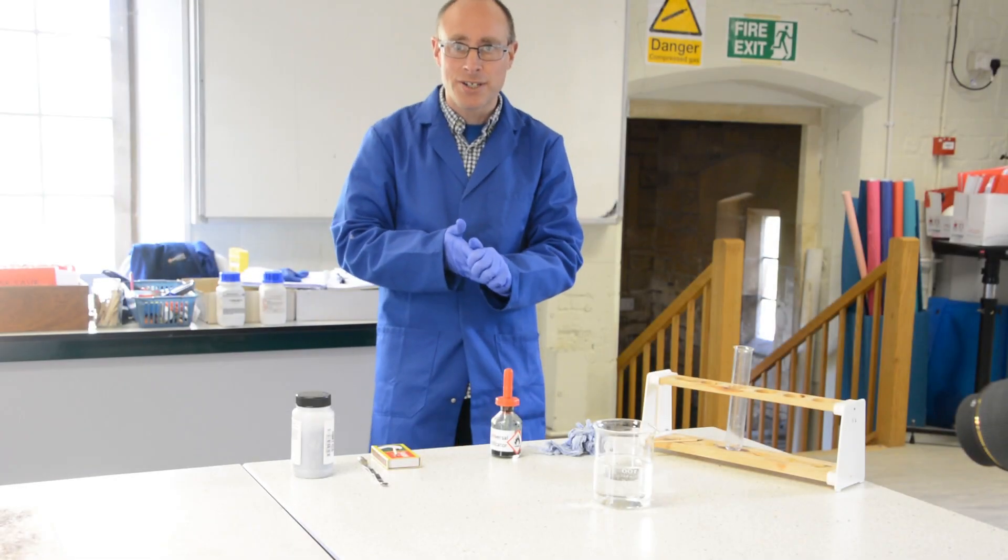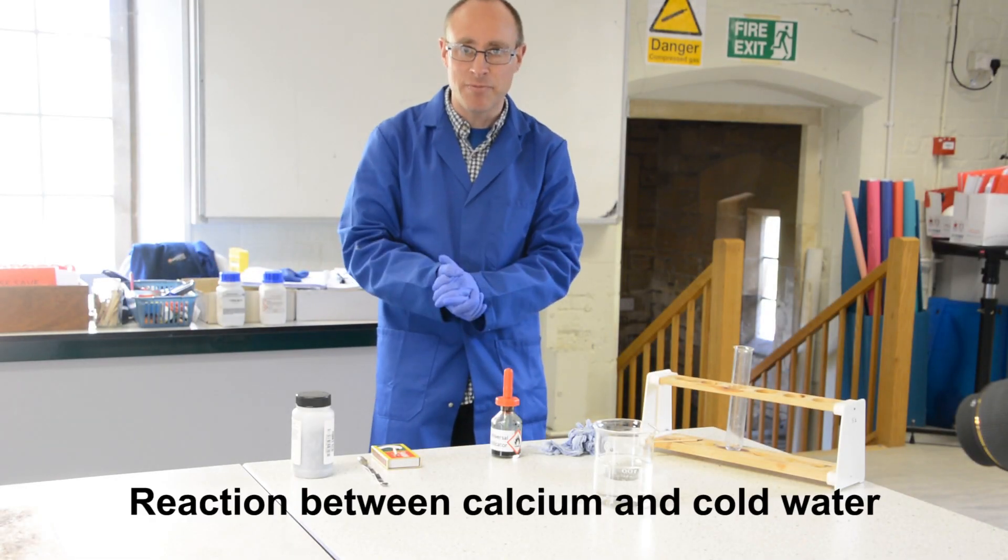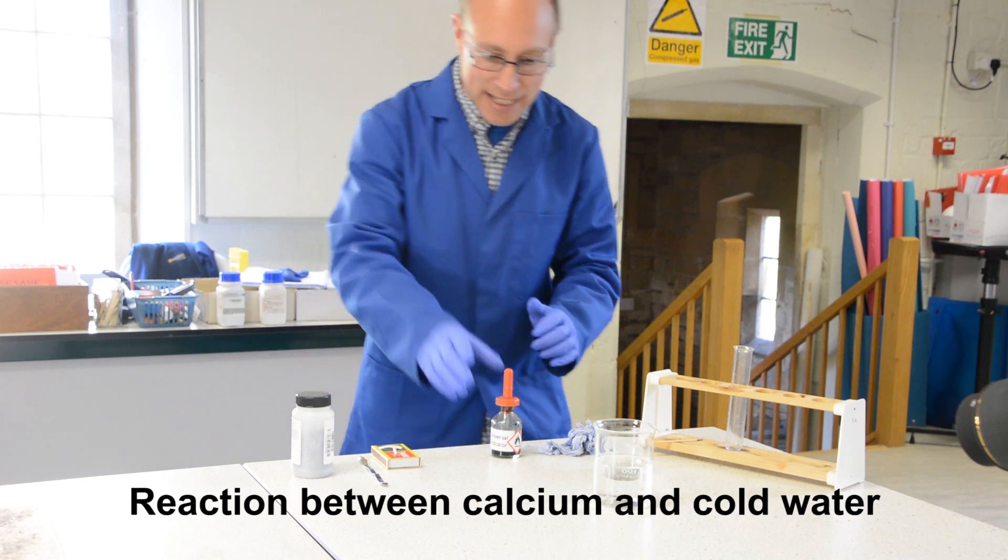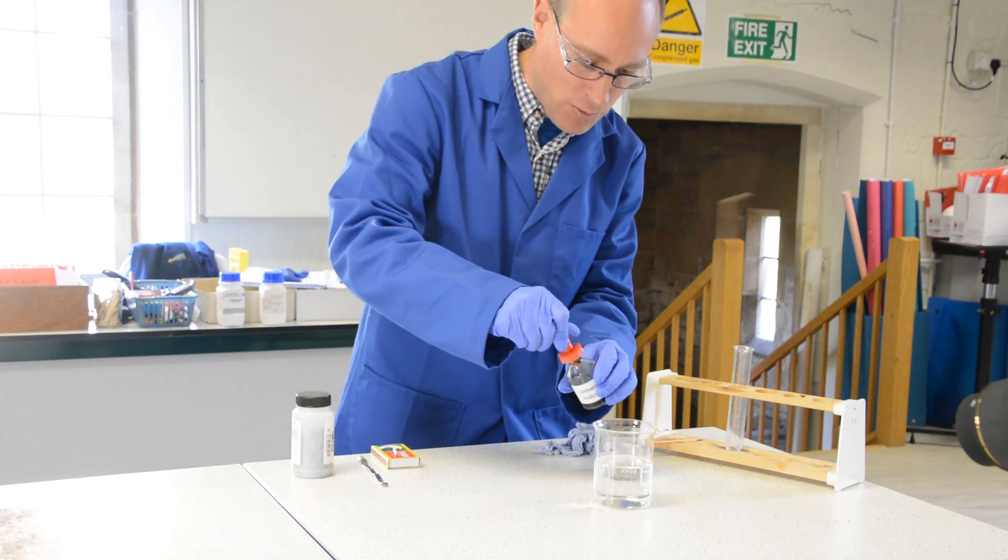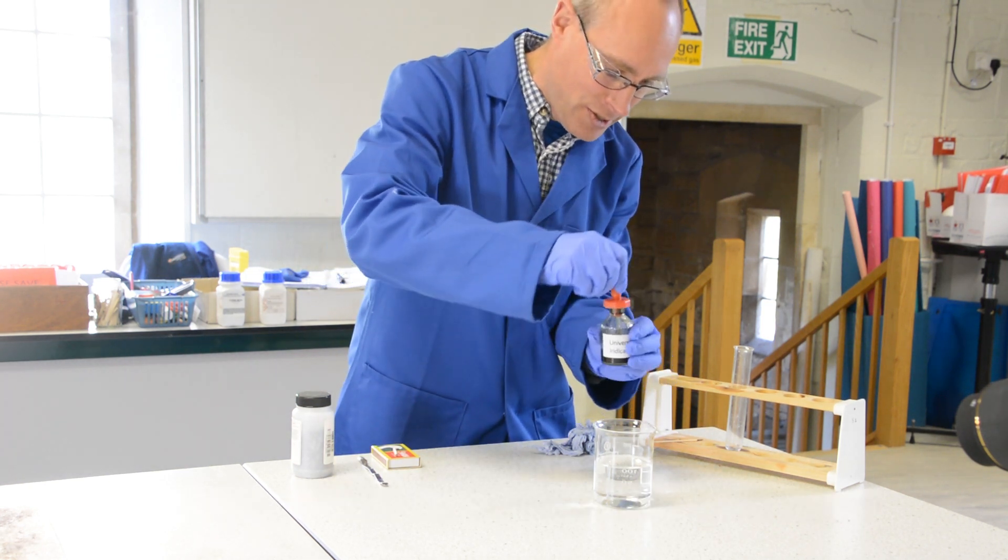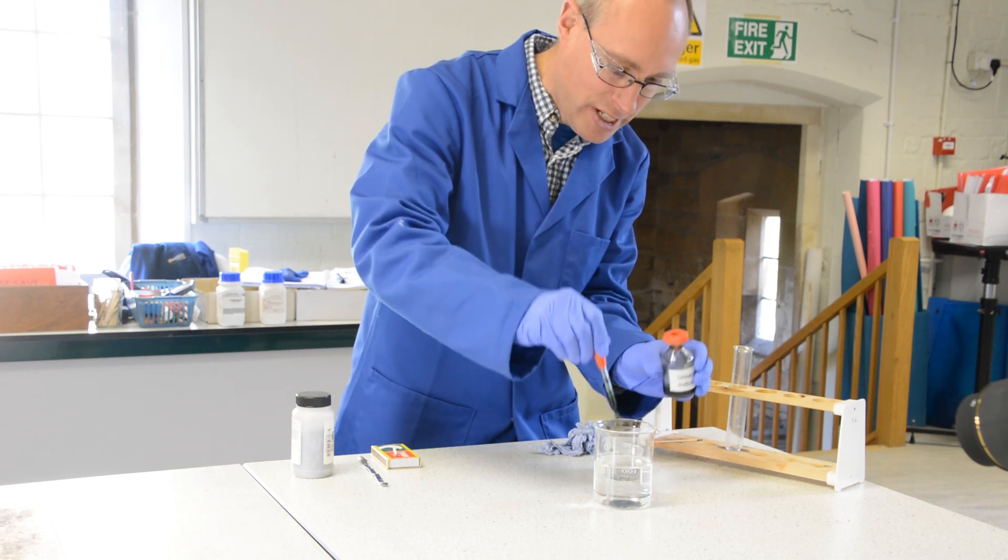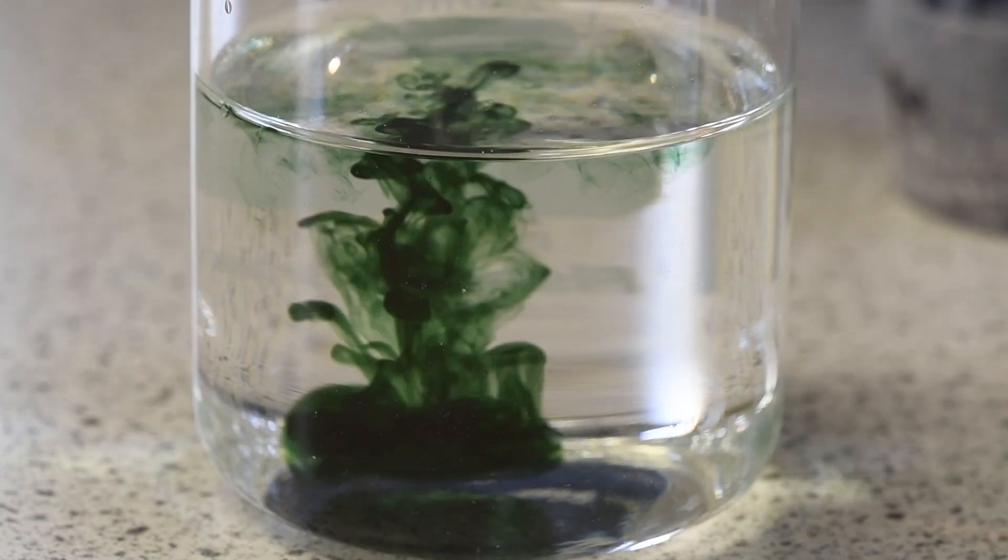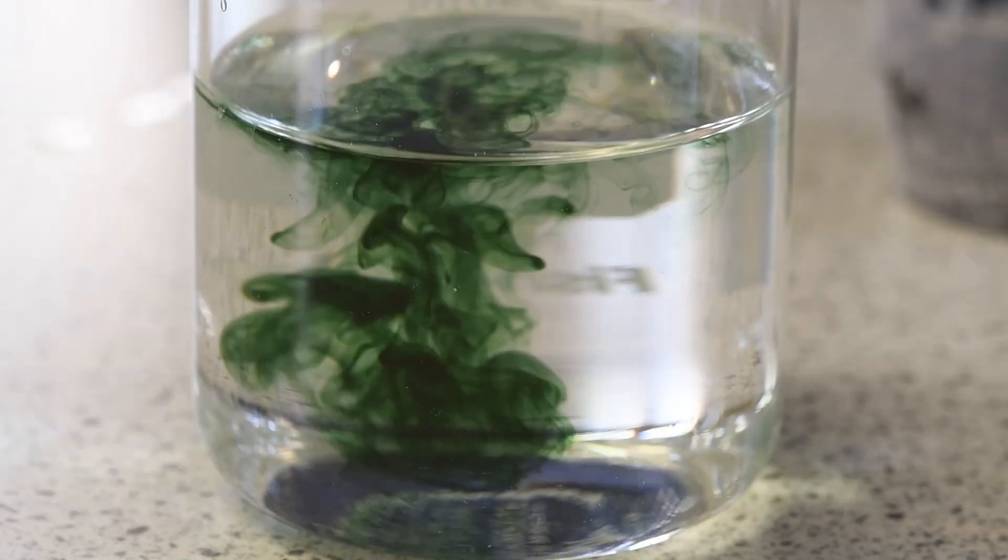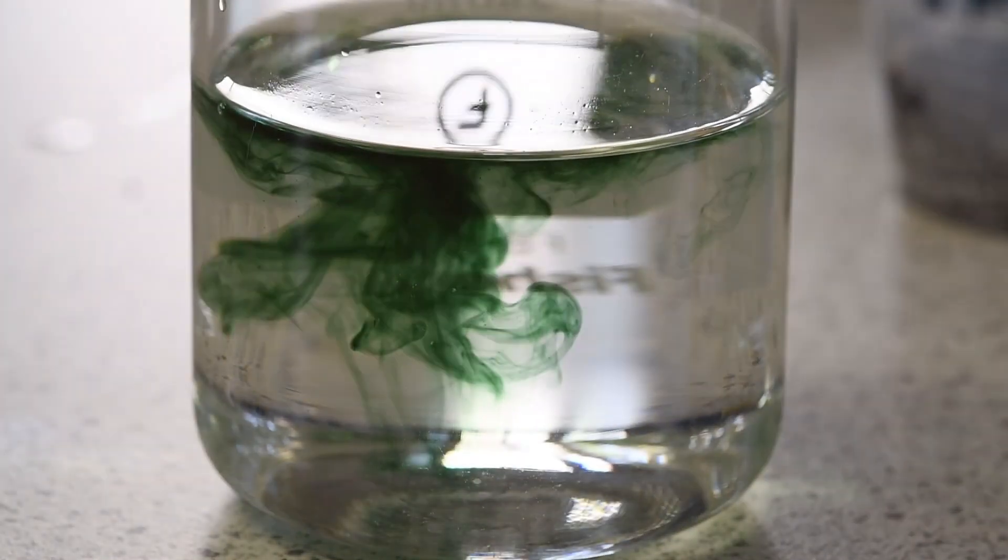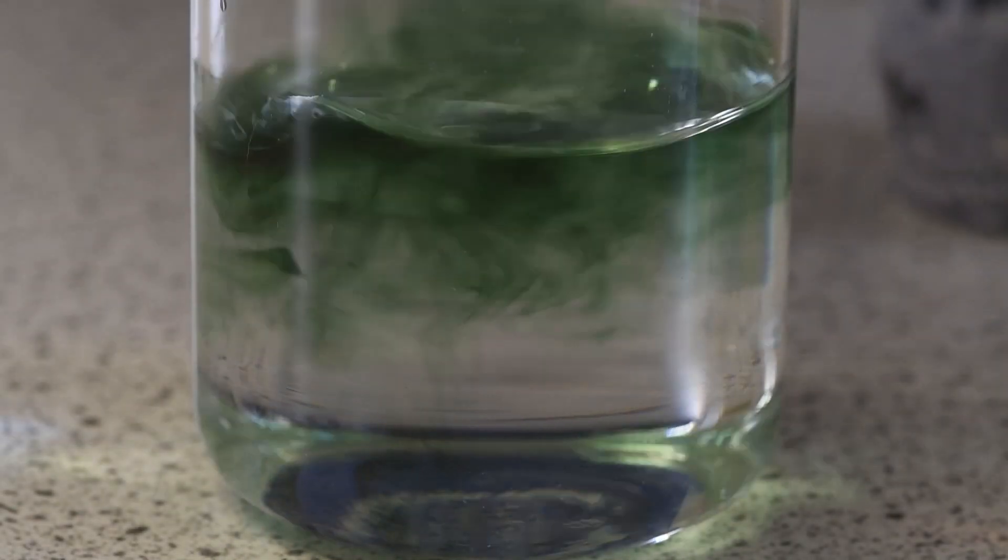So in this experiment I'm going to react some calcium with water. I've got some water with some universal indicator. The indicator is green, showing that the water is neutral.